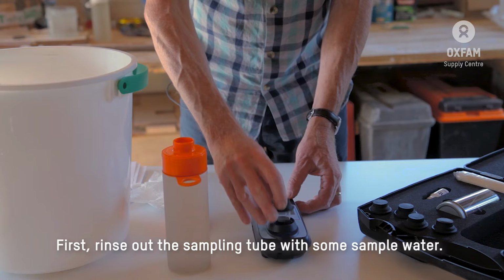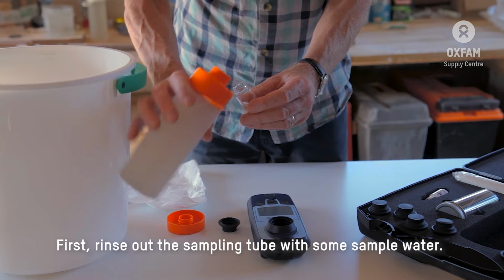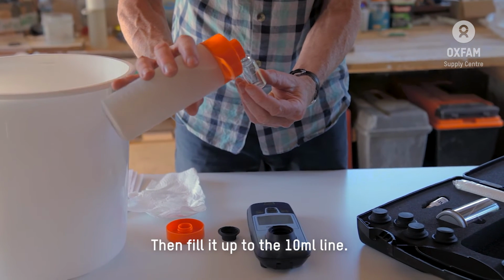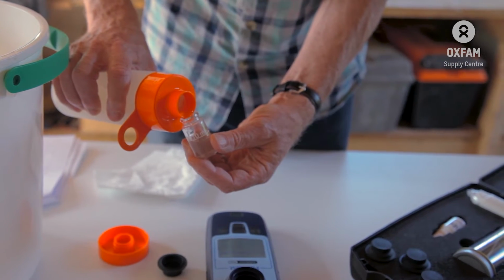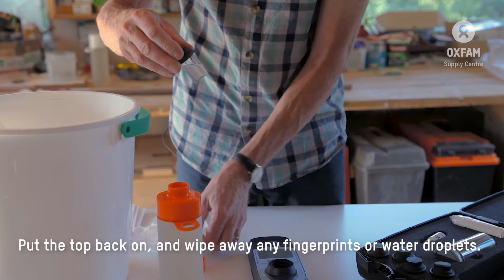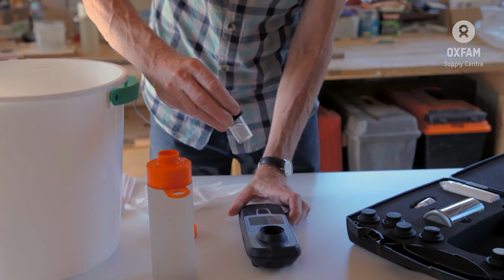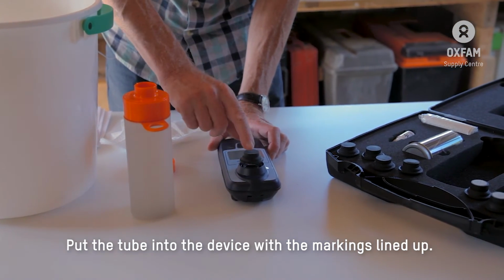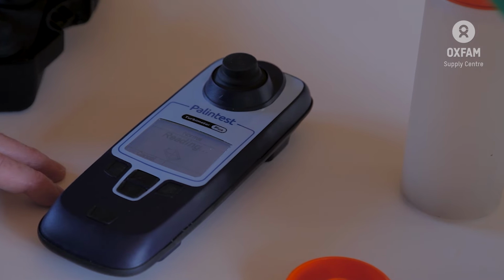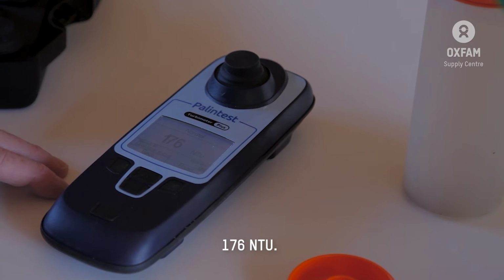So the first thing is to rinse out the sampling tube with a bit of your actual sample water. Then fill it up to the 10 milliliter line. Put the top back on, wipe away any fingerprints or water droplets. You put the tube into the device with the little markings lined up. You press the read button and your result will be there in a few moments. 176 NTU.